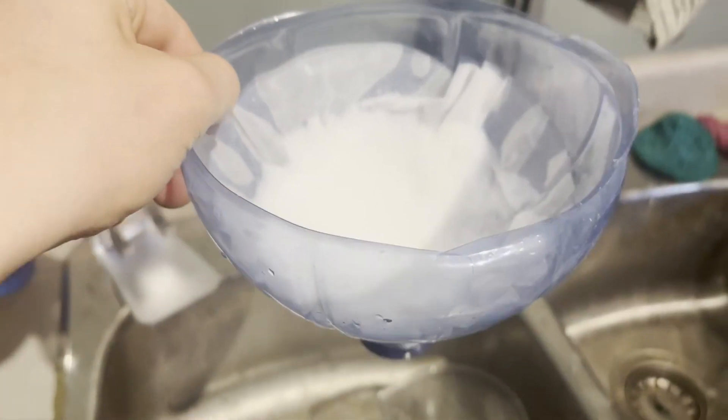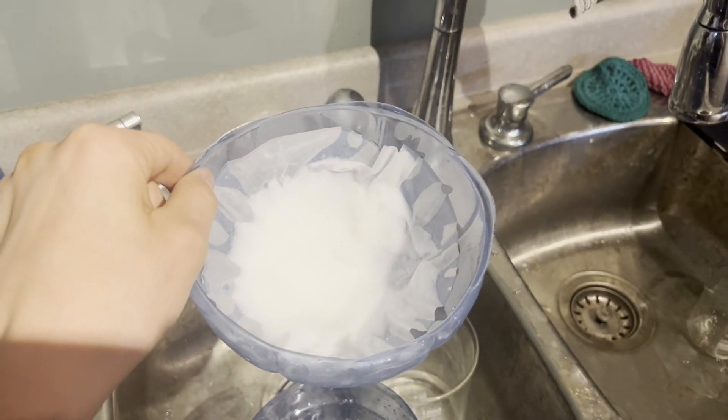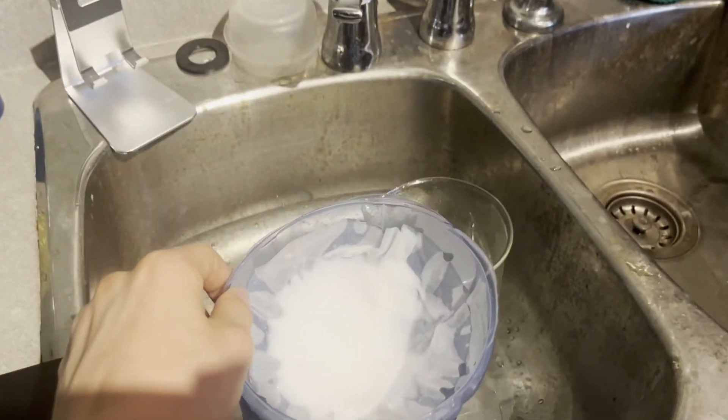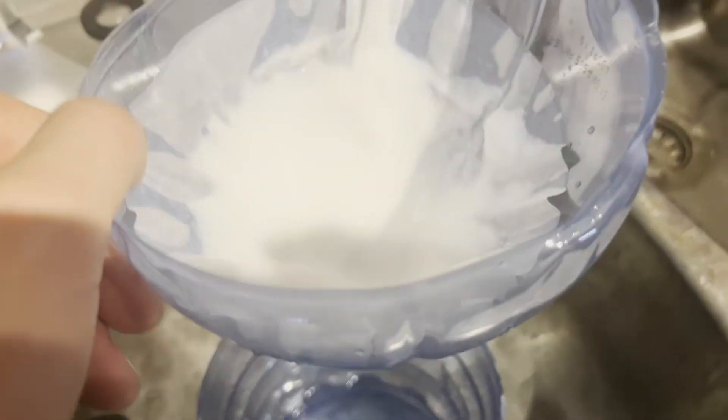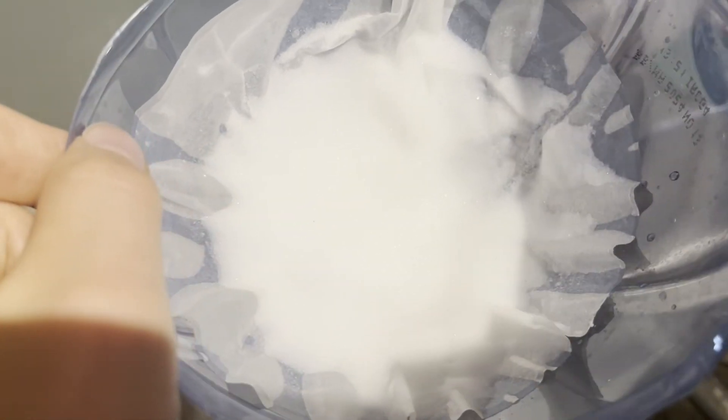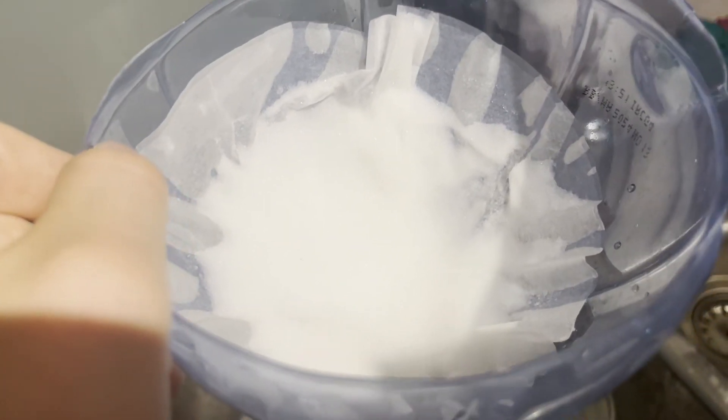Here's so much hydrazine sulfate it looks like I got. It'll go down once it starts to dry out because most of this is just water weight. Here I'm trying to show you that it sparkles. I didn't take photography in school so it's not really working, kind of unfortunate I decided to take like chemistry instead.